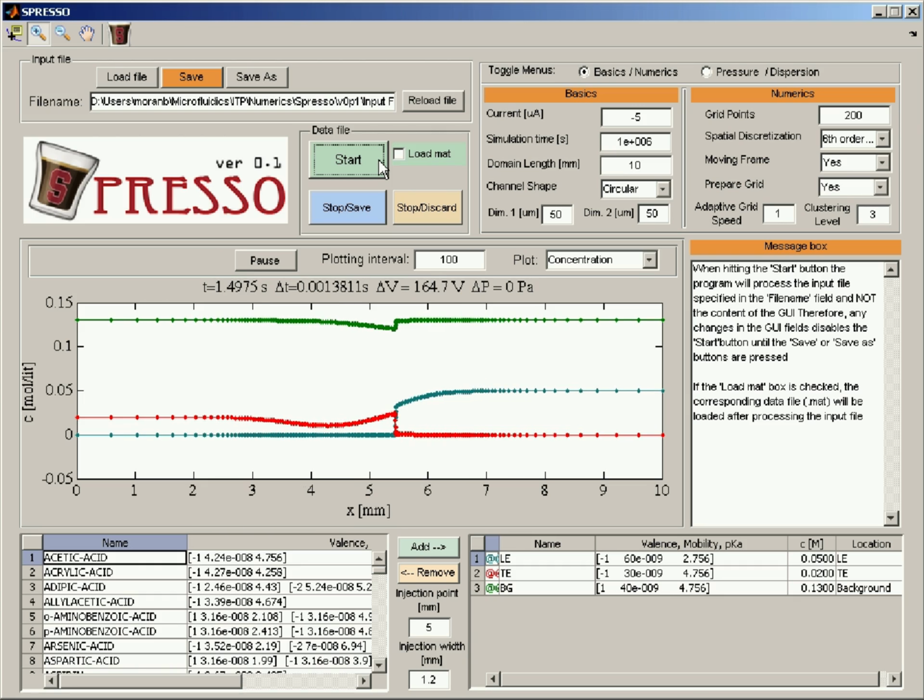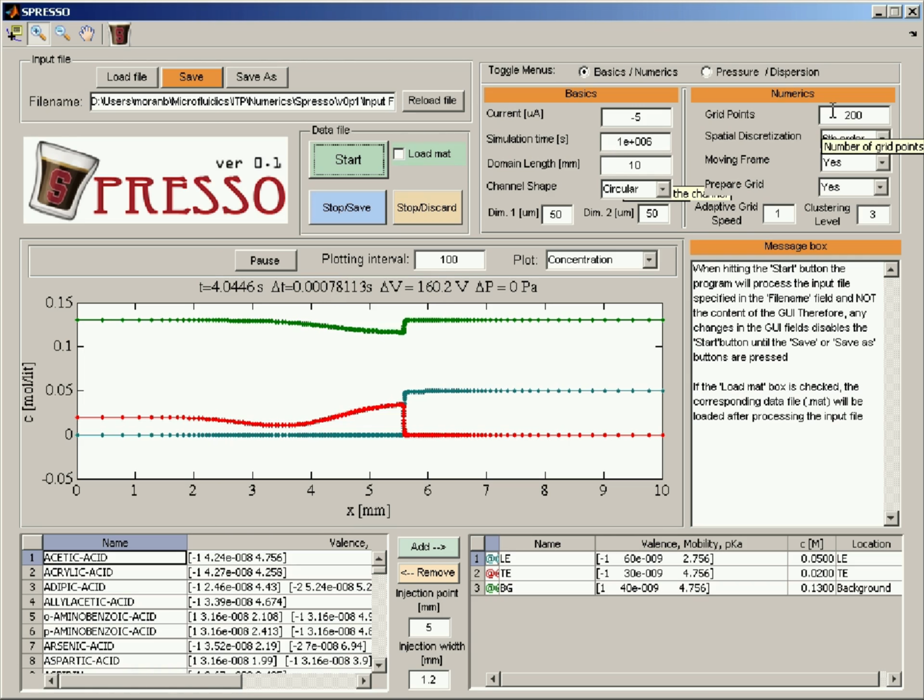So I'm not editing this video and not removing parts and showing you my mistakes as we go along to show you how to really work with this code and what's the path of thinking when trying to solve these problems and make it work. So these are the main parameters that you can use here when you want very accurate results: you would first turn on the adaptive grid. You can make it faster by decreasing the size of the domain and then decreasing the number of grid points and using the moving frame. And you would increase the clustering level if you see that you get oscillations and you don't have enough grid points at the interface.